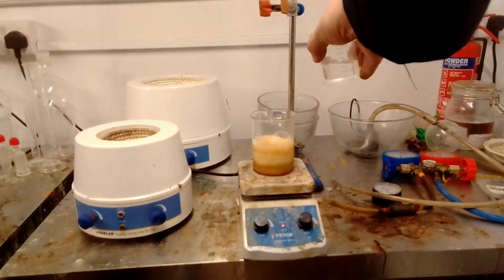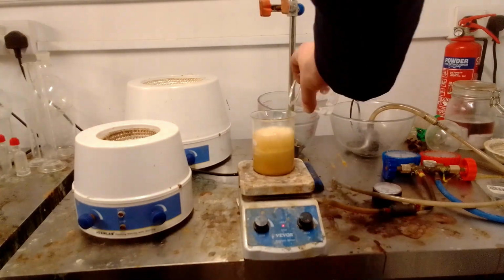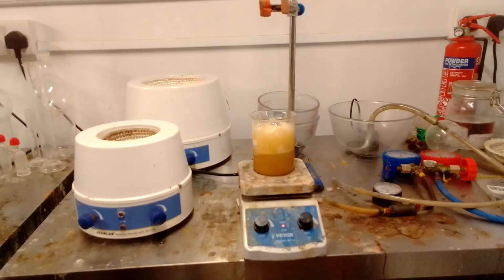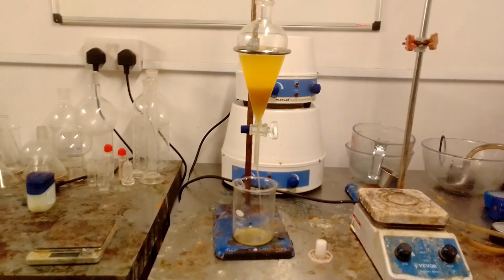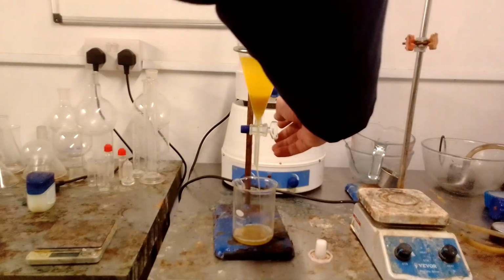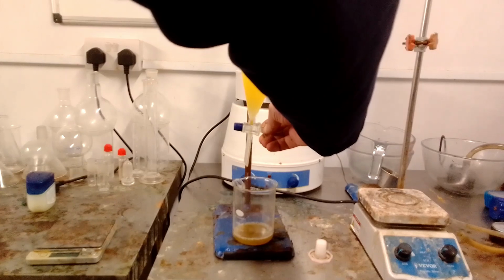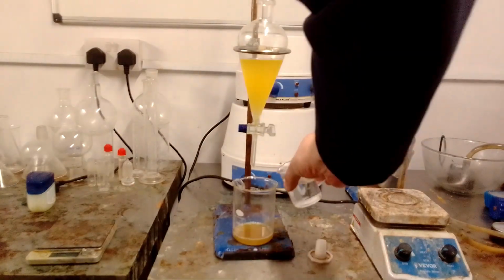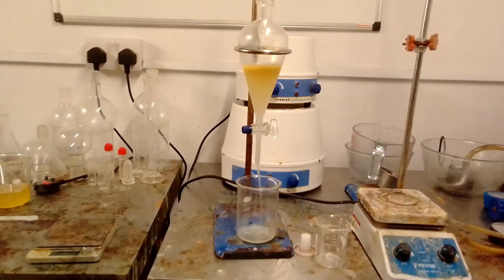Any unreacted borohydride impurity in the mixture was quenched by adding hydrochloric acid, which caused the mixture to heat up and foam vigorously, nearly spilling over the top of the beaker. Once it had cooled down, after about an hour, I separated the perchloroethylene hydraulic oil layer from the aqueous THF-DMF layer using a funnel, then mixed the non-aqueous layer with a 35% sodium metabisulfite solution for half an hour. This was separated into 2 phases using the funnel.